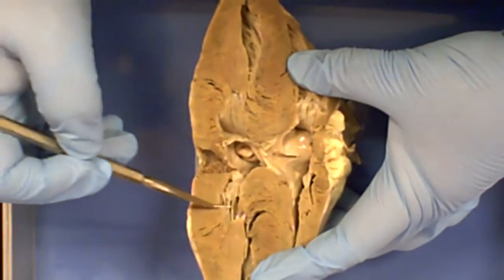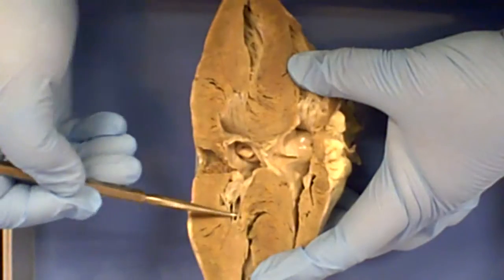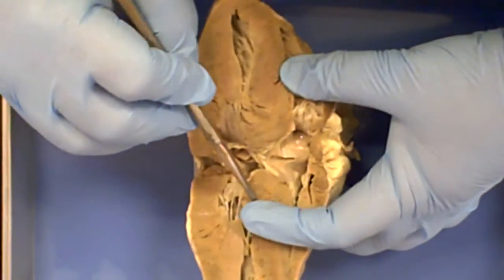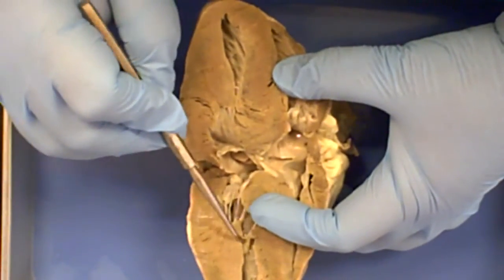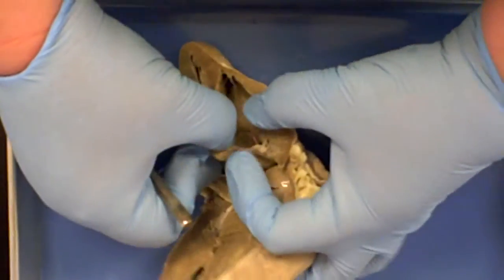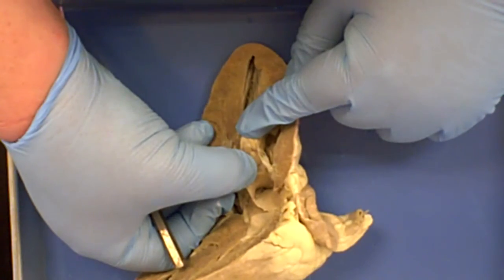These valves are supported by the strings, called the chordae tendineae, or the tendinous cords. So they really do look like cords, like strings. And they are anchored down here to little bumps of muscle called the papillary muscles. So there's one there. We've got them over here as well. So just find a string, find one of the chordae tendineae, and follow it to the wall of the ventricle, and you will find the papillary muscles.